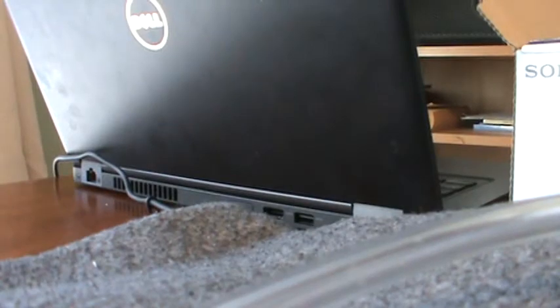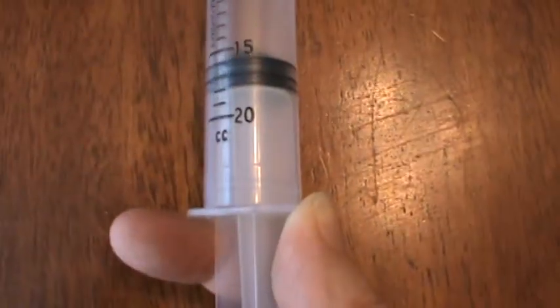All right, I have to set this down for a minute, sorry, to change my hold on here. All right. So that one was 13.8, James? That was 15.8. That was it? Okay, 15.8. So now what I'm doing is it's really, really hard to do this.